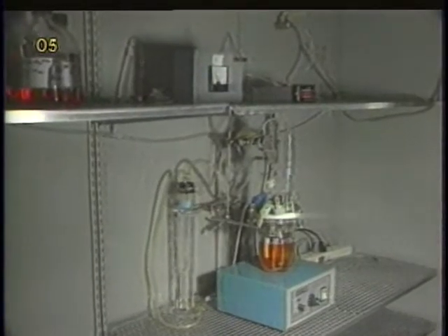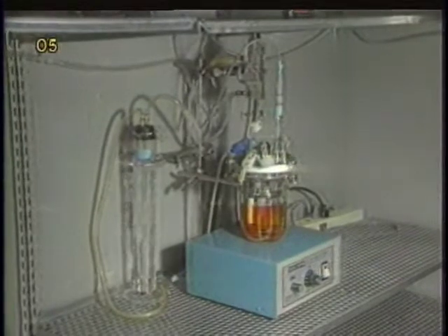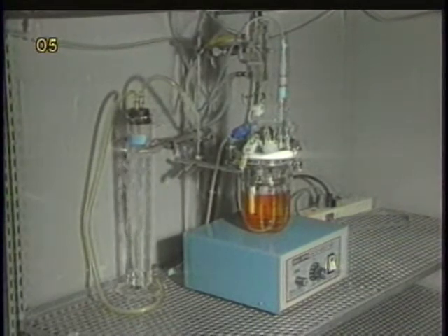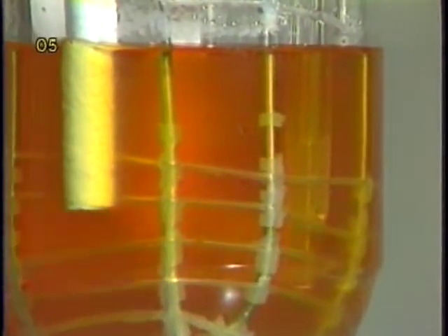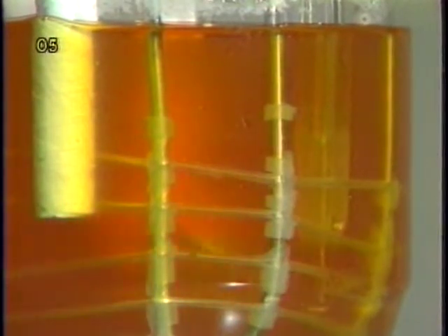It has been noted that animal cells are sensitive to excessive mechanical agitation. A low agitation rate is usually used in cell culture. The major purpose of agitation in mammalian cell culture is to suspend cells or microcarriers and achieve fluid mixing, not to disperse air bubbles for enhancement of oxygen transfer as in microbial cultures.